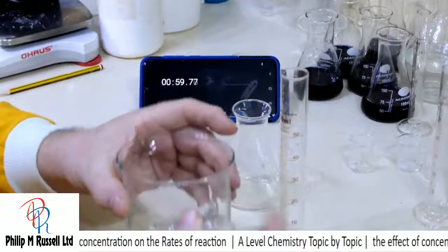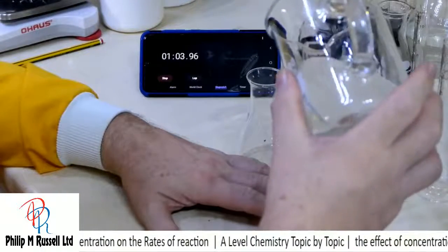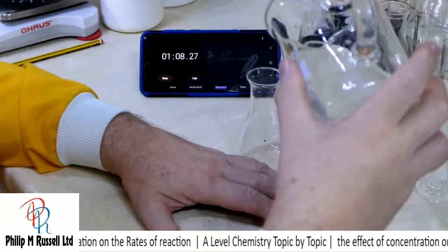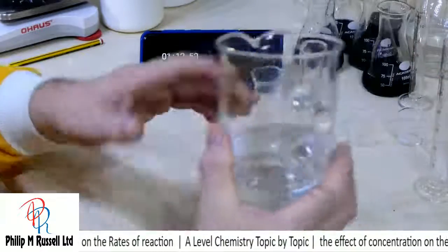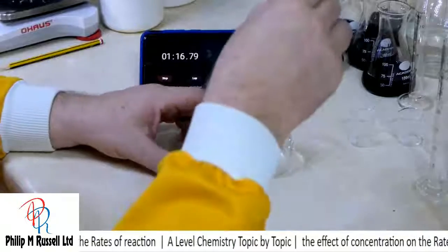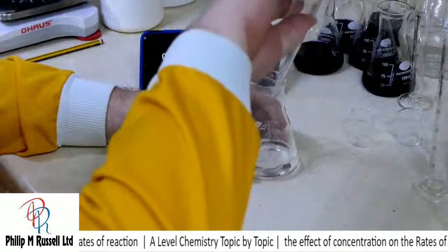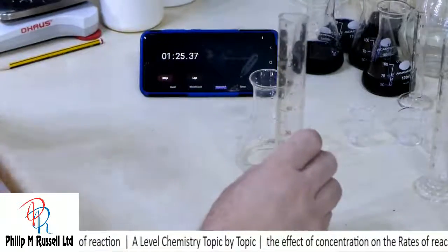You may ask, why have we done it so many times? We've done it so many times because I thoroughly enjoy doing this reaction, and I just wanted to show off as a good reason for doing it lots of times. Usually when I do this to my students, we have to do it a whole load of different times. 30 mils plus a drop that I missed.